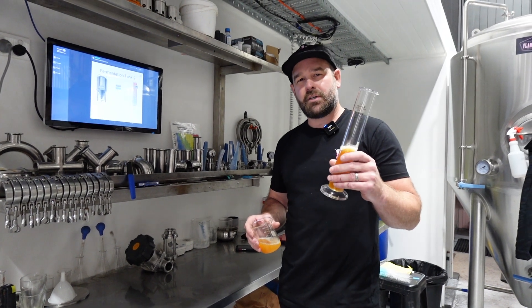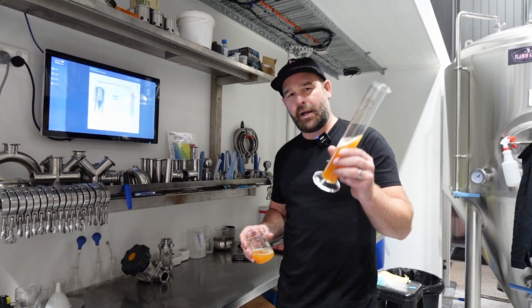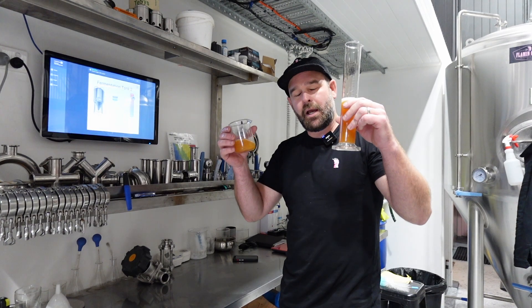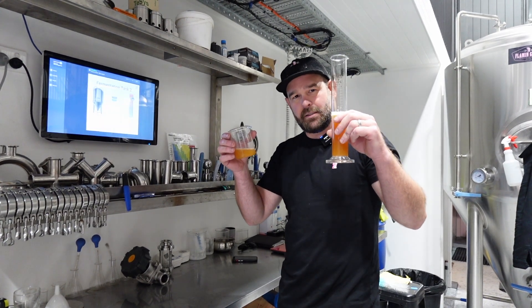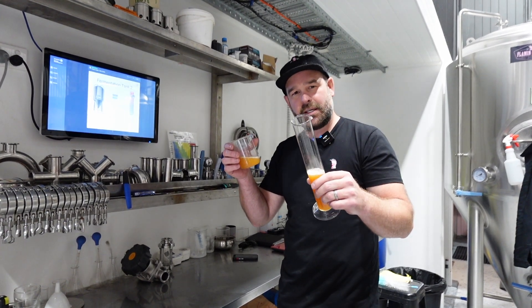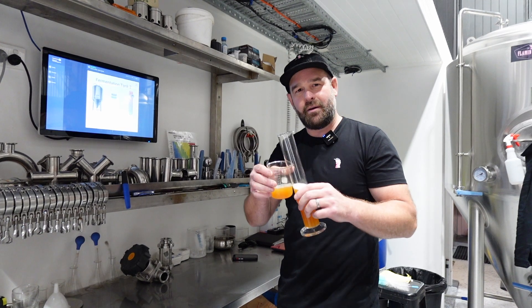Ever tasted butterscotch or artificial butter in a beer at a commercial brewery? It shouldn't be there. Let me show you how to do a forced diacetyl test and get rid of it all.